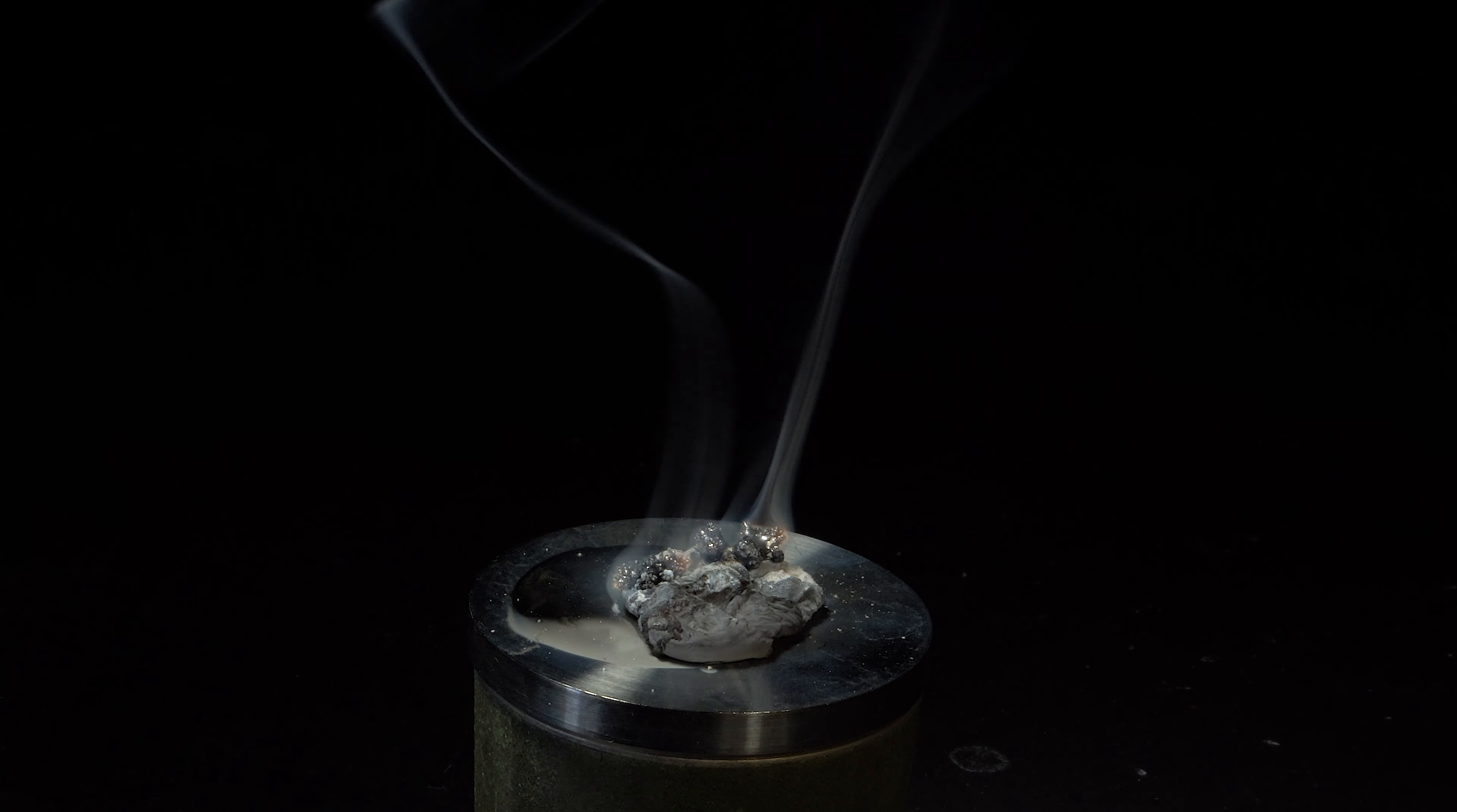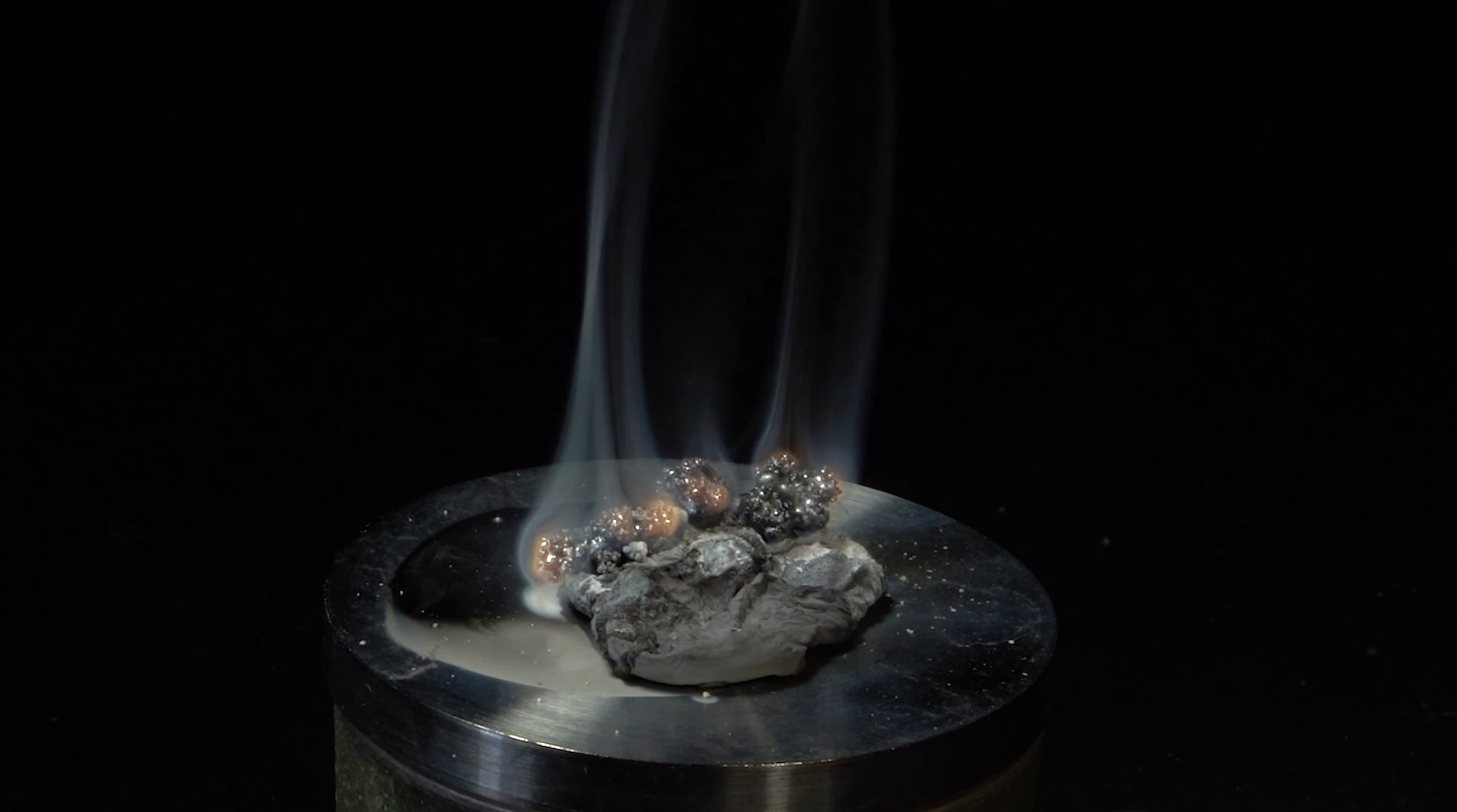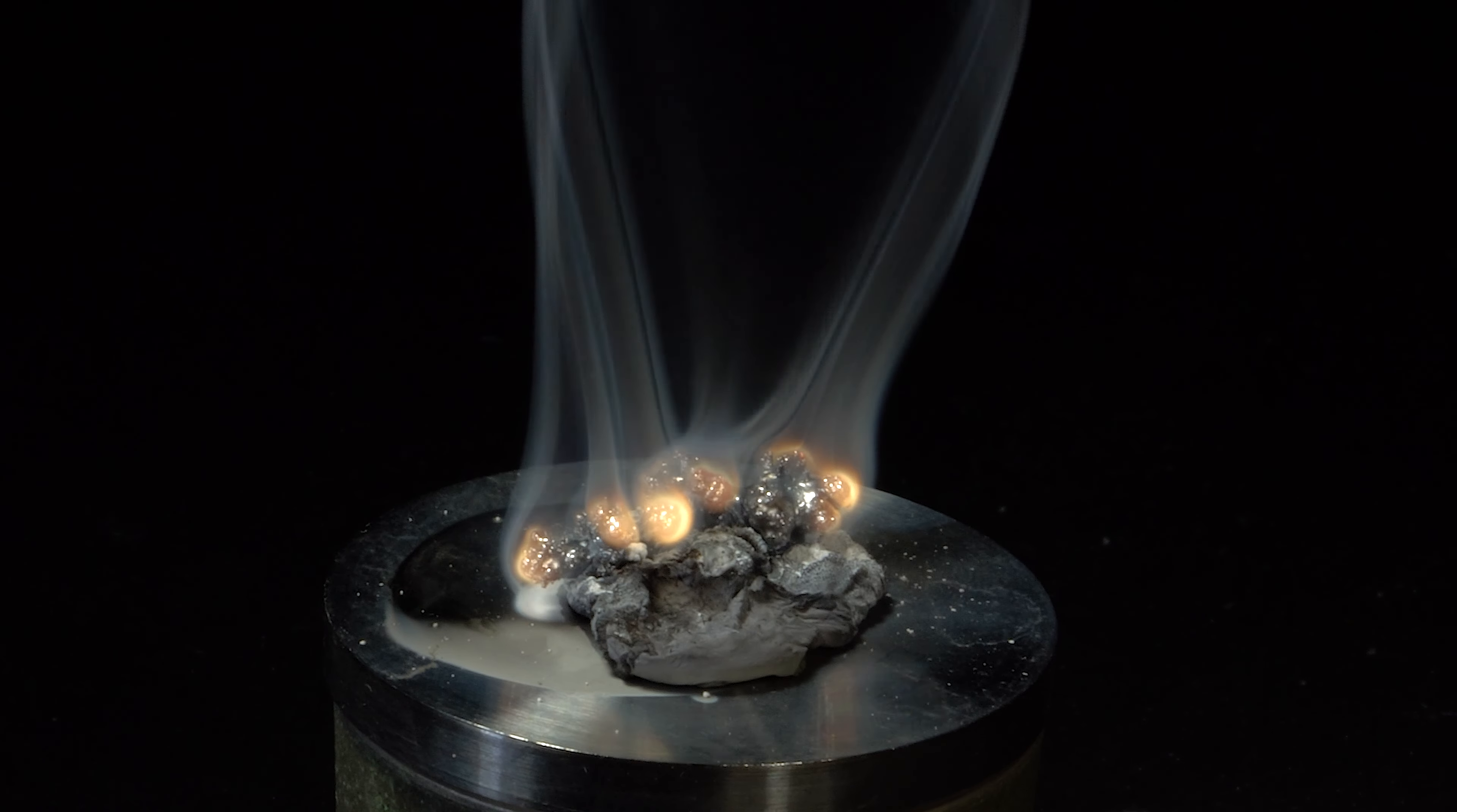I used lithium in this experiment because it looks more visual and attractive in my opinion. Besides, it's a very well-known reaction, the components of which are used as a propellant in some types of torpedoes.